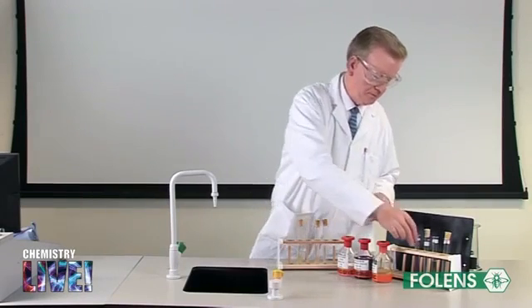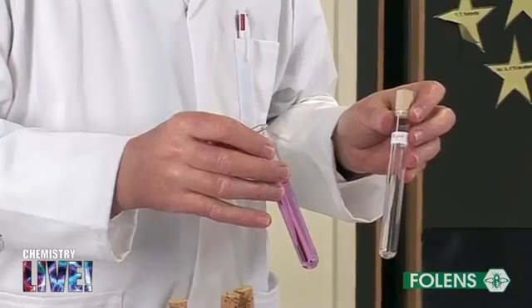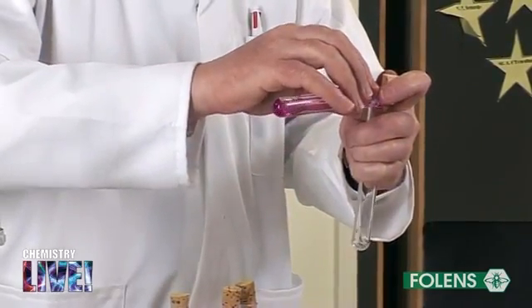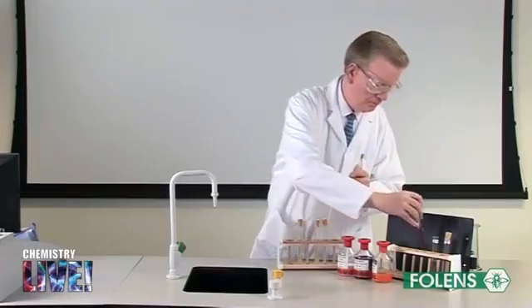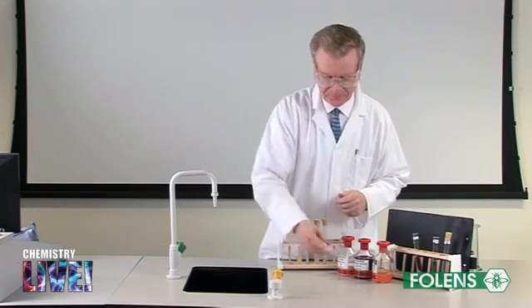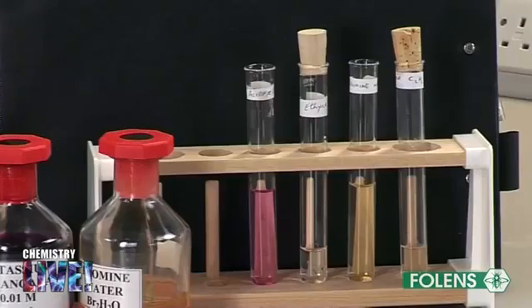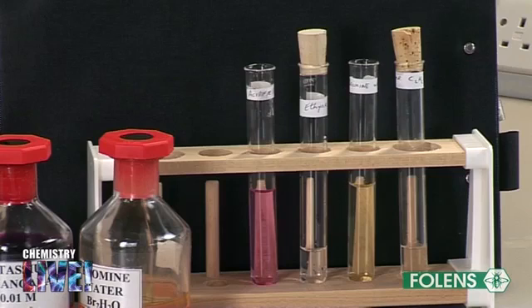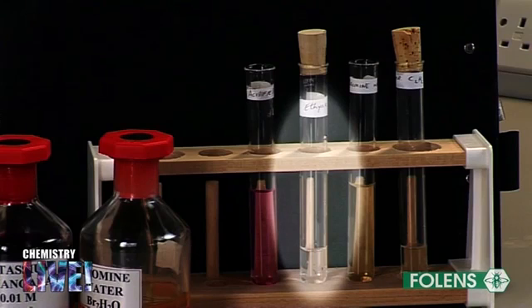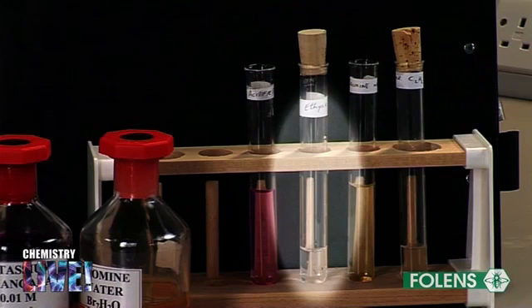Addition of acidified KMnO4. Potassium permanganate can be used to test for unsaturation. Add about one-tenth of a test tube of potassium permanganate to a test tube of ethyne. Replace the stopper and shake the test tube a few times. Note that the purple colour disappears and a colourless solution is obtained. The very reactive carbon-carbon triple bond reacts readily with the potassium permanganate. You are not required to know the equation of this reaction or the names of the products for this course, hence it will not be discussed further.